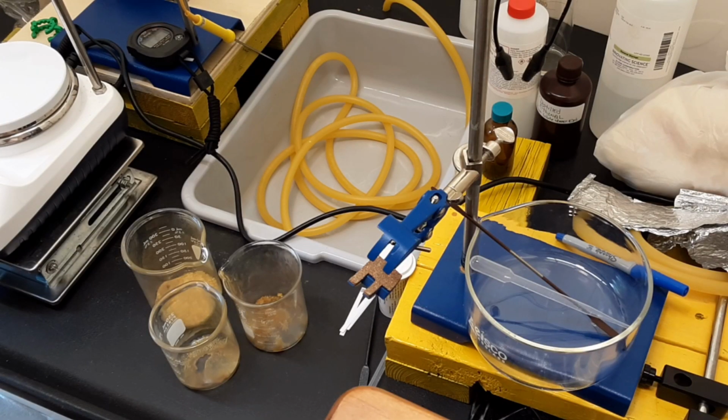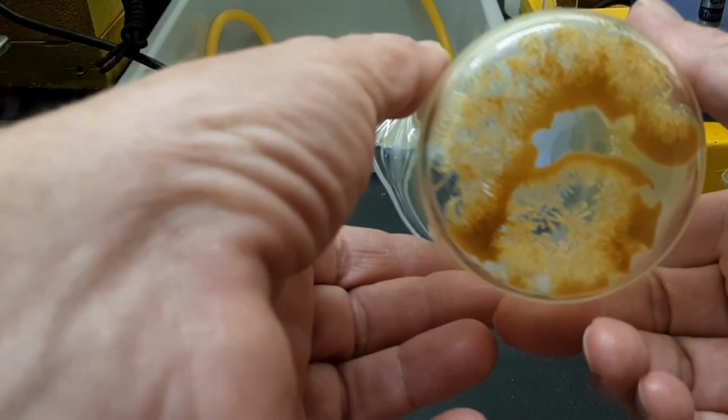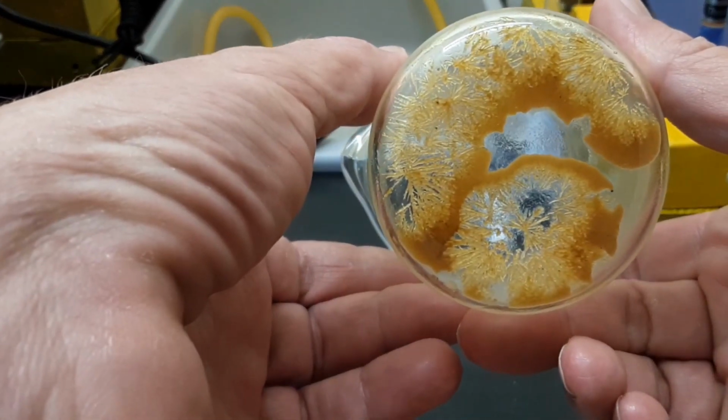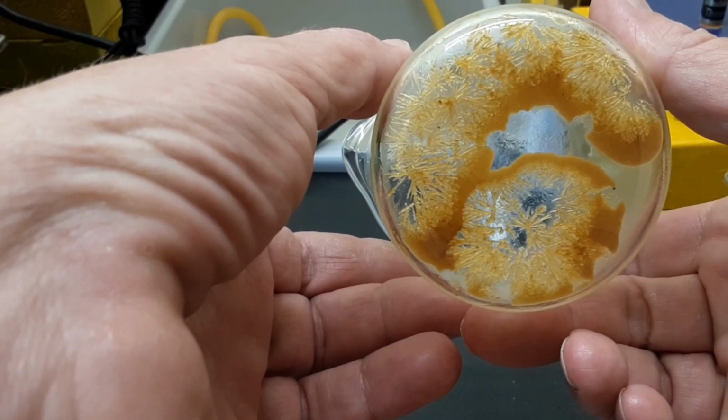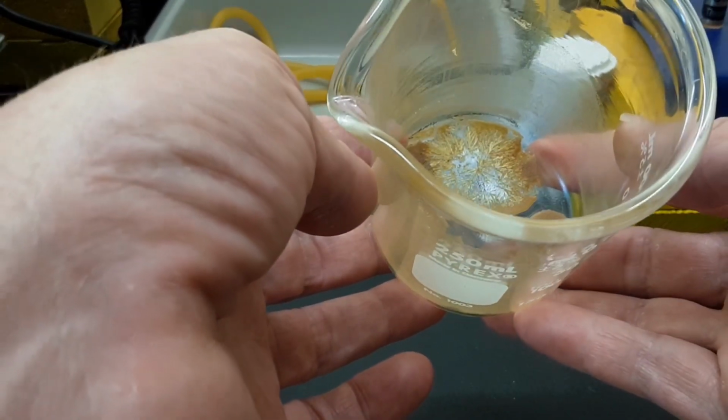Today I'm going over my 3 piperine extractions to show you what I ended up with. I just don't think any of the results were really good, considering I never did a crystallization in my whole life. This was my first batch of 100 grams of black pepper that was done in IPA that had 5 grams after the funnel filter.